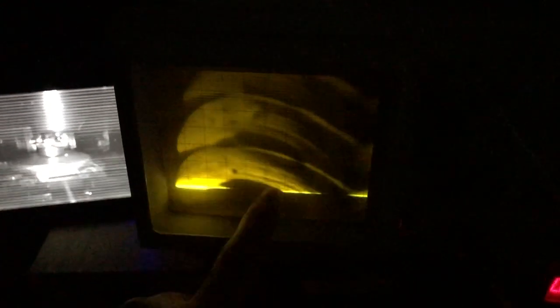And we can see, I moved the sample a bit. And also we can see the focus is quite well adjusted. So I'm changing it to real time mode. Okay, now we can adjust the magnification and move the sample. Okay, and do a slow scan. Sorry, pushed the wrong button. Okay, here you can see it's quite well focused.